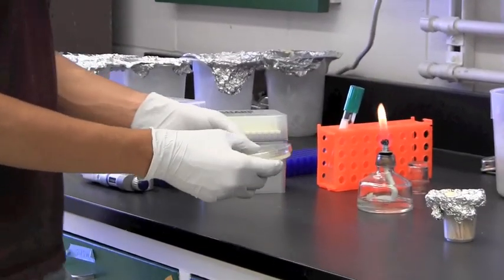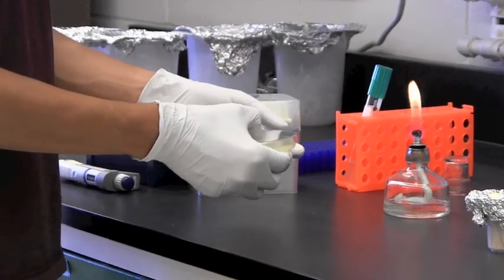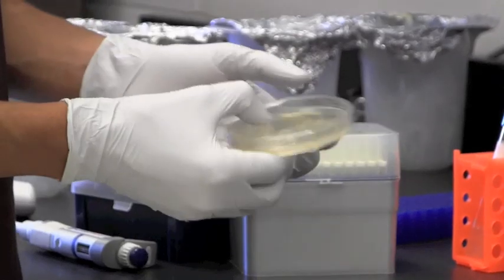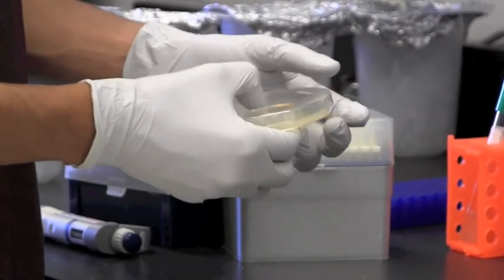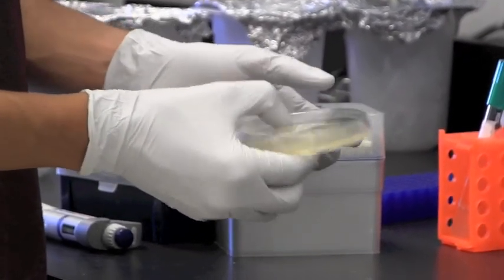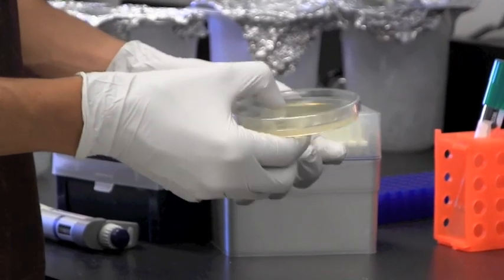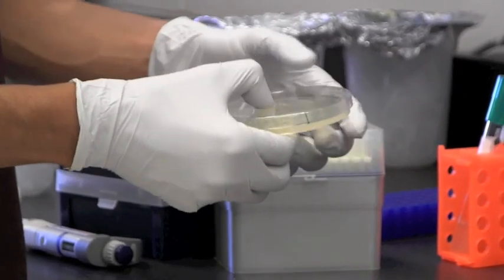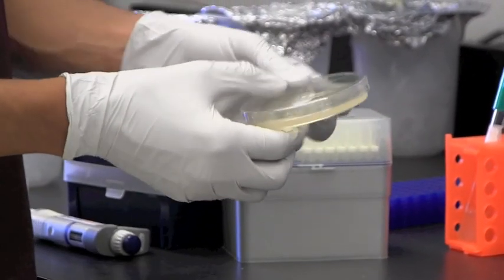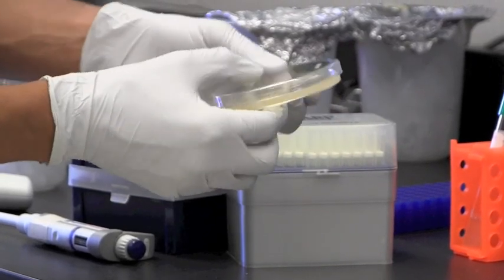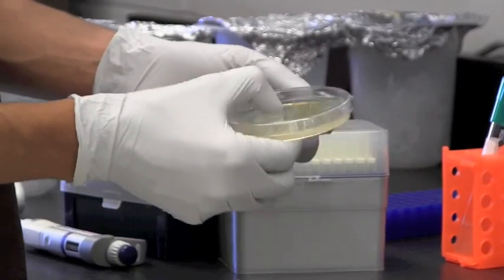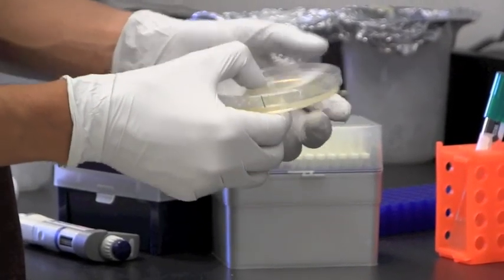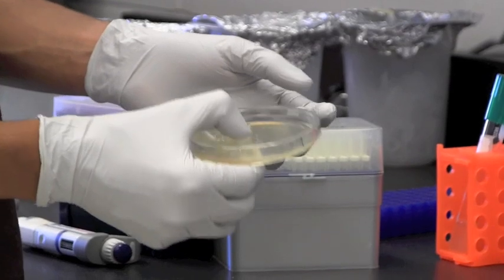So now making sure that your plate is closed properly, I'm going to shake the beads off. And if you see closely, I'm spreading my 120 microliters of inoculum evenly on the surface. You want to make sure that the beads are colliding against one another and going all over the surface to get as much area and as uniform as possible.